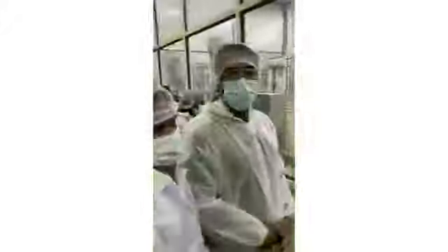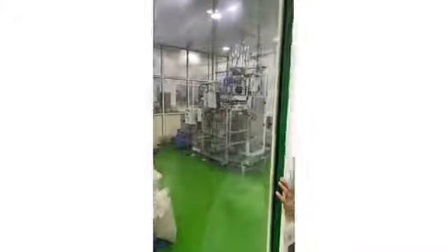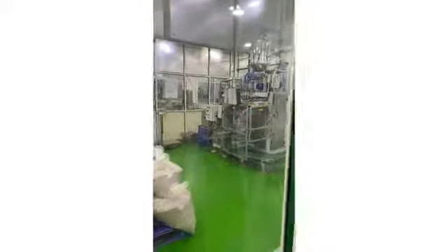And left hand side you can see the iGlow packing machine. This is our iGlow packing machine, one of the iGlow variants we have. Same there in this unit, that tanks, reactors, the batch will be made. From there the line is there. It will come out here.